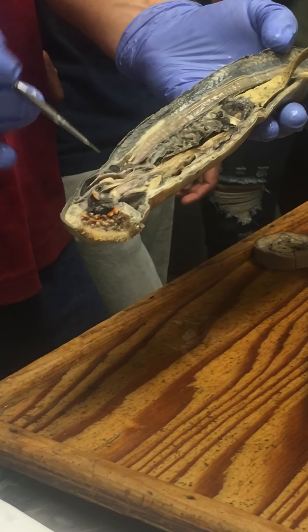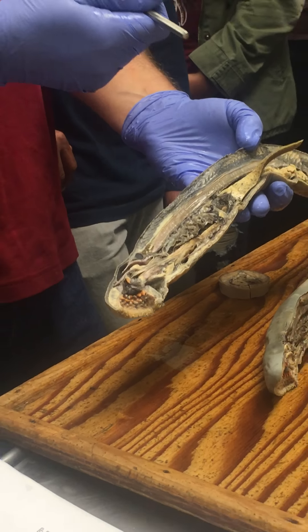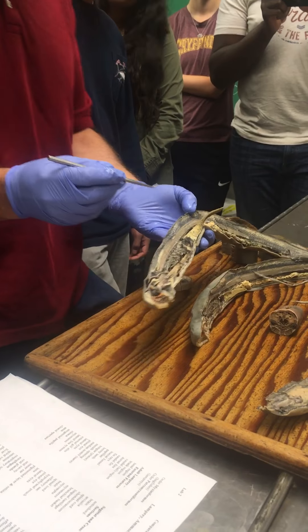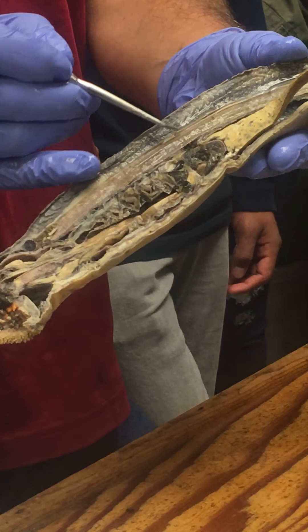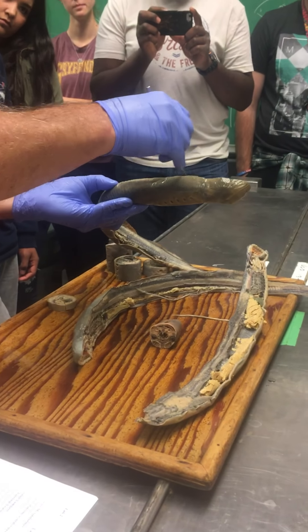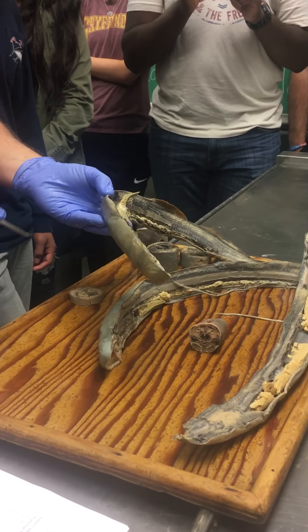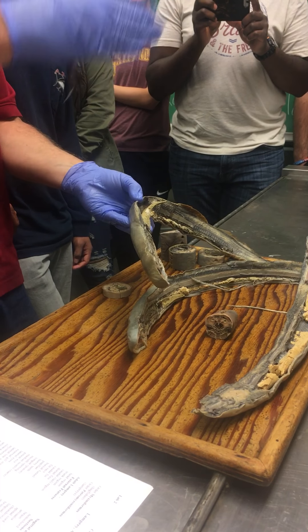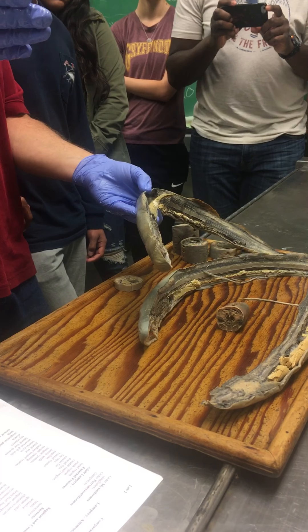When we look at a sagittal section — remember sagittal is down the midline, separating into left and right halves — the notochord is very prominent, this structure here running along like this. Some people had sections where it didn't show up very well because the slice went either to the left or right side and missed the notochord.